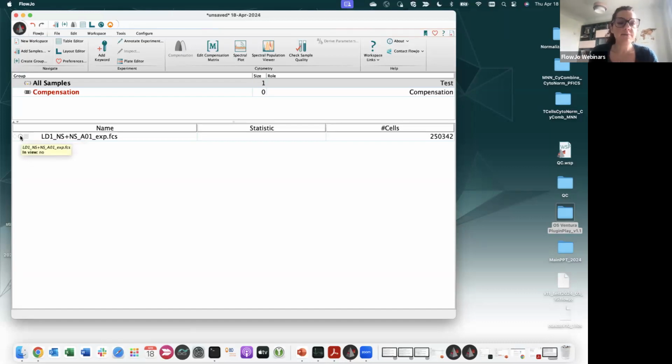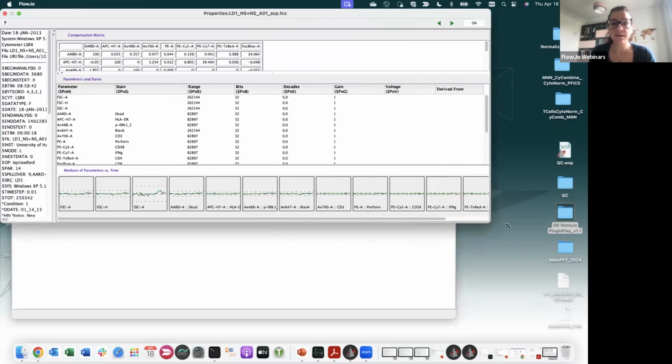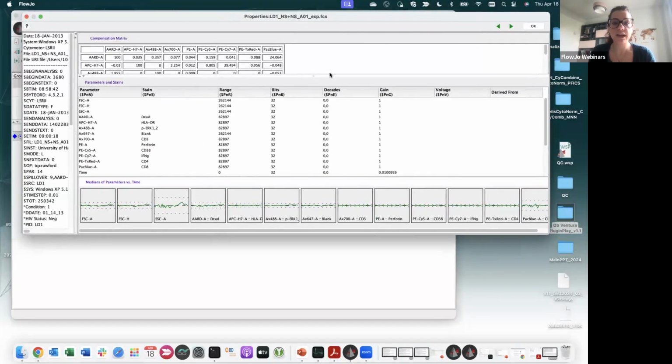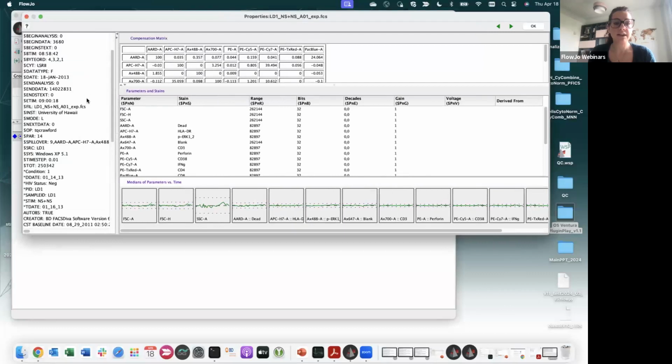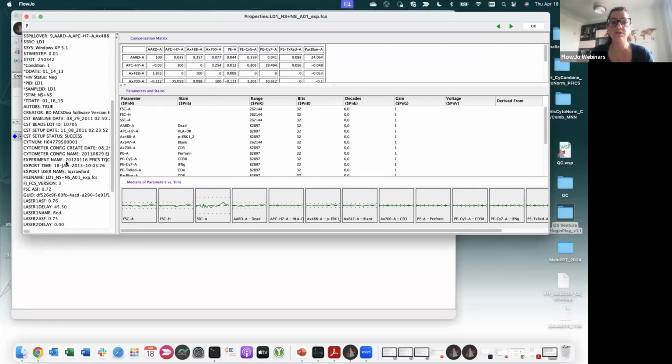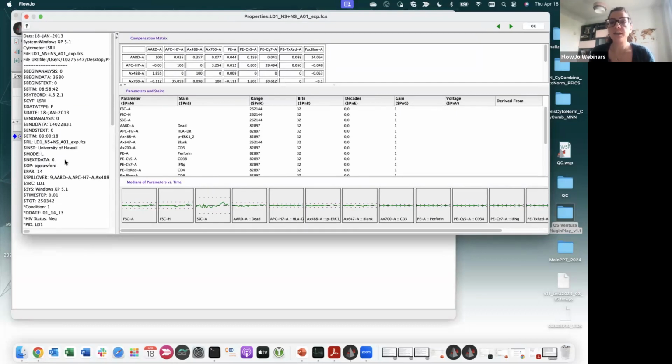So if I double click on this, I will inspect the file. I can also use the check sample quality. Okay, and now I have a blue badge. But if I want to inspect it, here is all the information that I get. I have all the keywords on the left side, all the information from the instrument, if I had CS&T beads, and so on, all the checks that were done, which are the parameters, which are the lasers, the instrument name, the date, and so on.